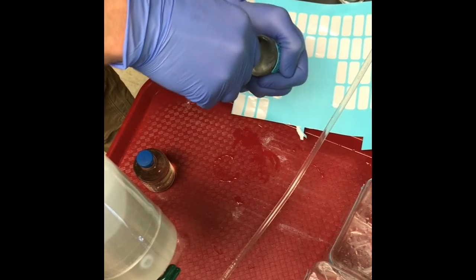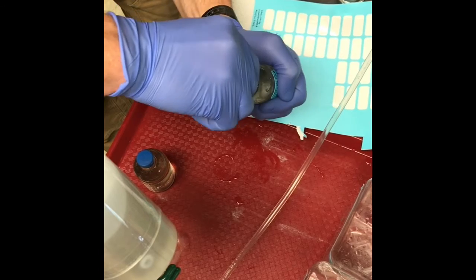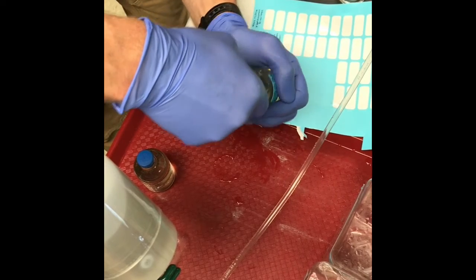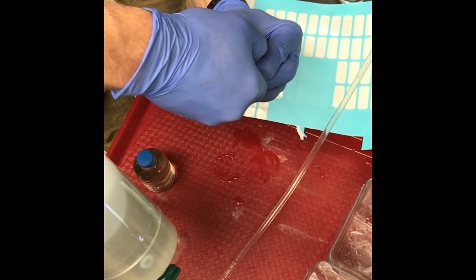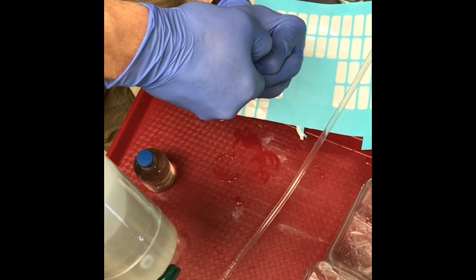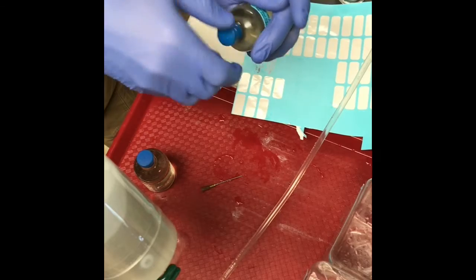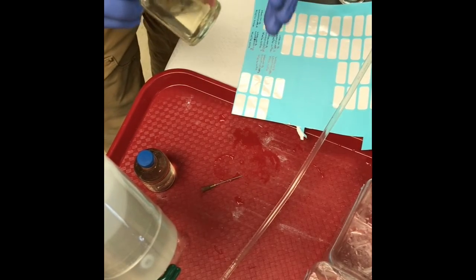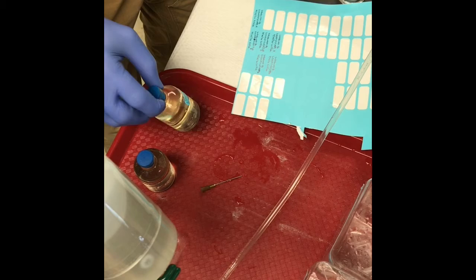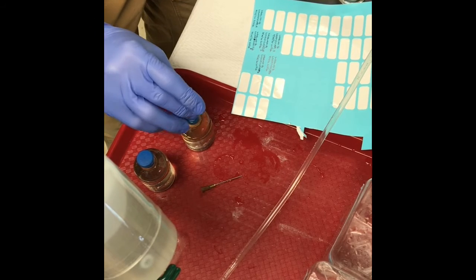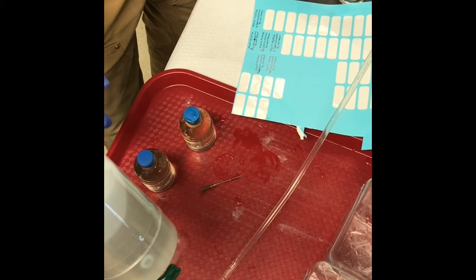Getting the last little bit of oxygen out. Once all the bubbles are out, we can carefully take out the needle. There are no bubbles in there, so the zinc should preserve the sulfide in a way that we can measure it later.